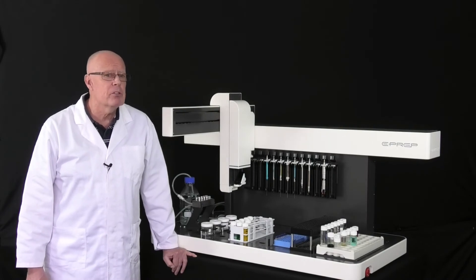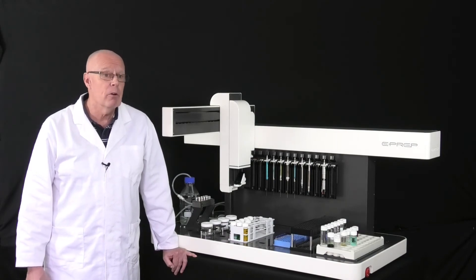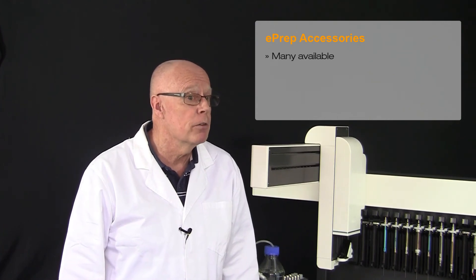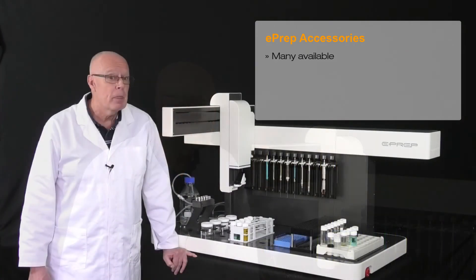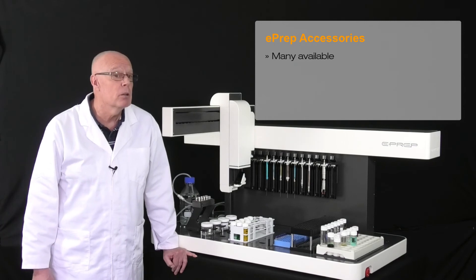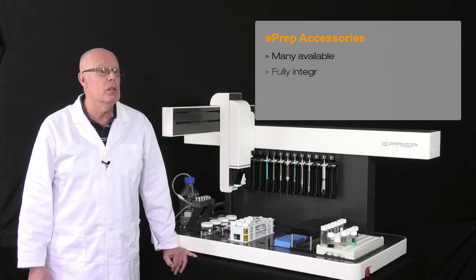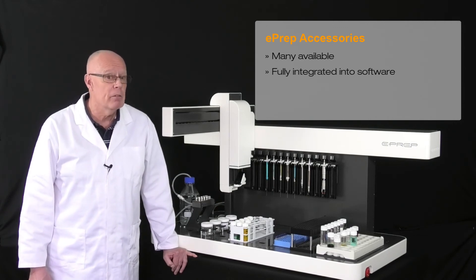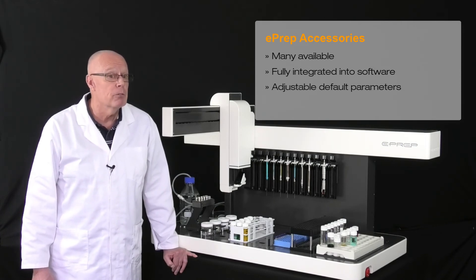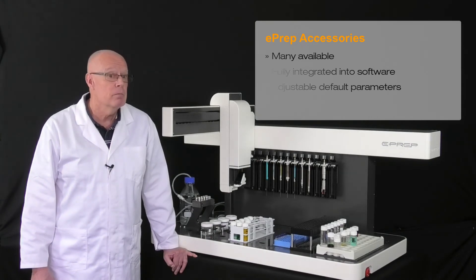We realise there are such a variety of standard sample preparation techniques out there. So to add versatility to the E-PREP, we have a range of accessories to accommodate this — from a solvent manifold for large-volume solvent use, to a vortex mixer, to disk filtering, and a rack for solid-phase extraction clean-up. These are all available, and in each case, as these accessories are added, they are fully integrated into the E-PREP software. Each accessory will have its own unique set of controllable parameters, but there are default values for each, which means the time from unboxing to using them in the workflow is very short.